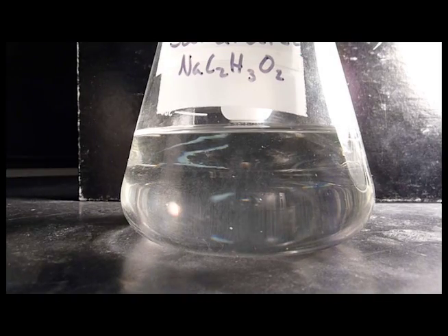Hey, it's Cam Ed. Today we're going to look at the recrystallization of a supersaturated solution of sodium acetate. Try saying that 10 times fast.